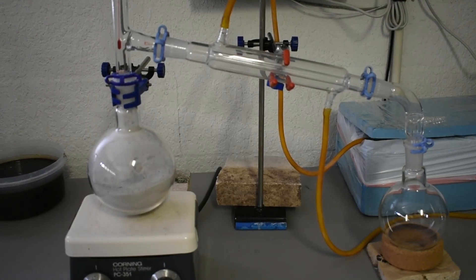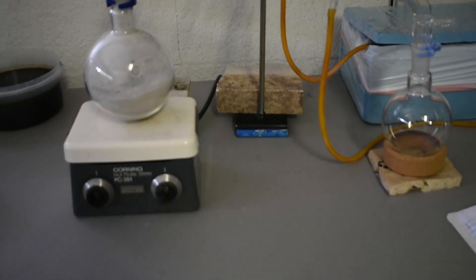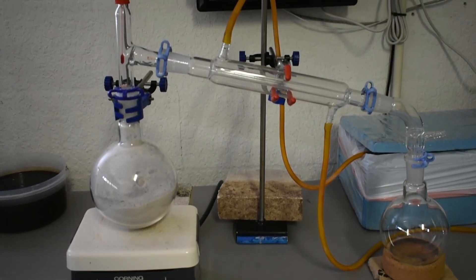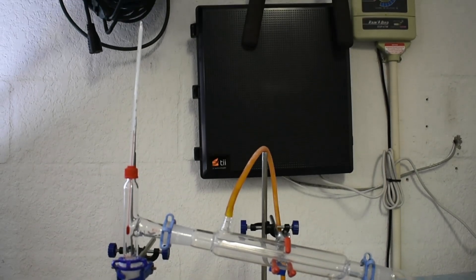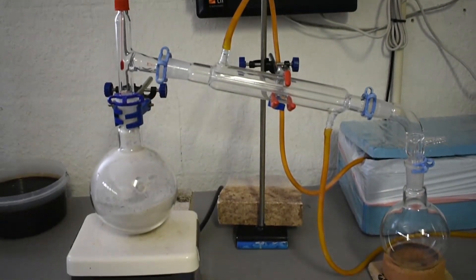Alright, as you can see, I've set up for simple distillation. I've got my hot plate, round bottom flask, thermometer all the way up there. I've got my tubing.